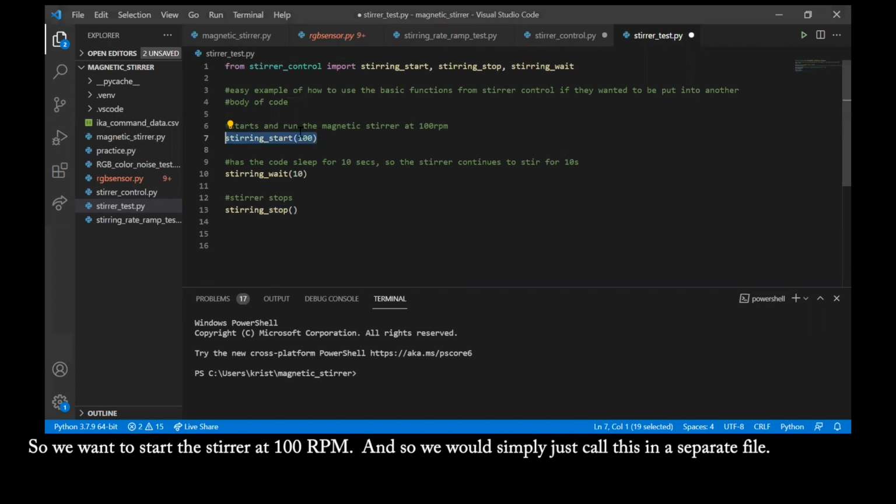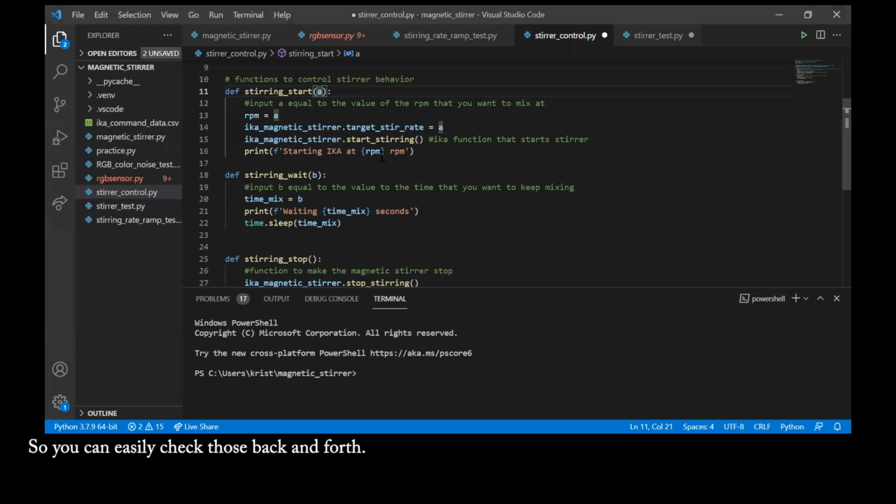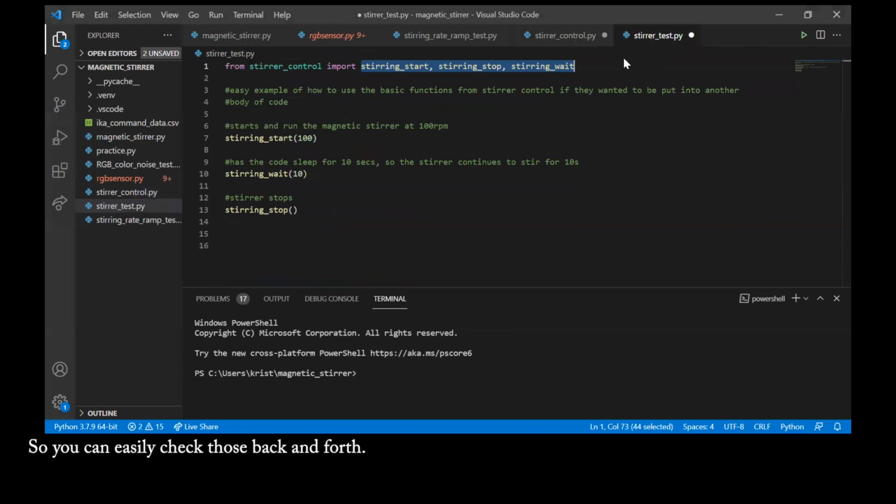So we want to start the stirrer at 100 RPM, and so we would simply just call this in a separate file. Initially, too, we would have to import our functions into whatever code we are calling them in, and this is how you would type that in. So stir control would need to be in the same file that we are having stir test run in, and then you can easily just import the functions that were created, which are the same names as in stir control. So you could easily check those back and forth.